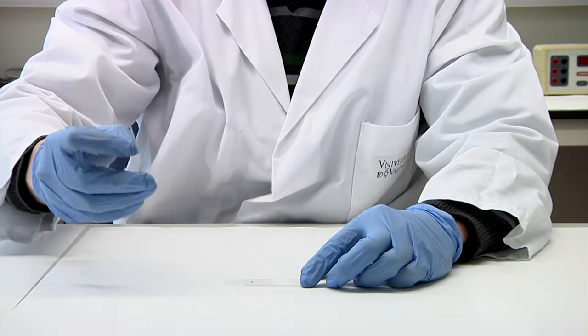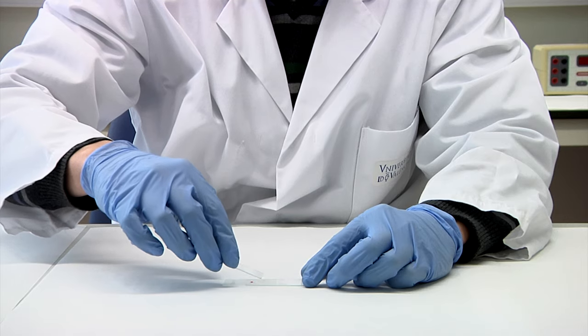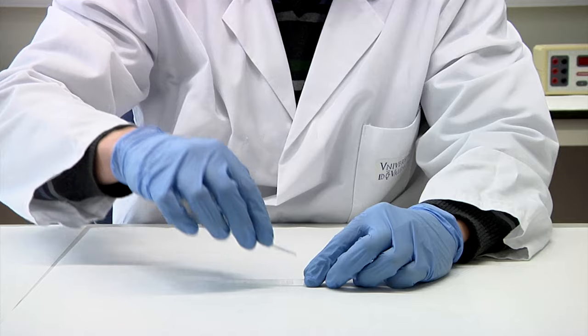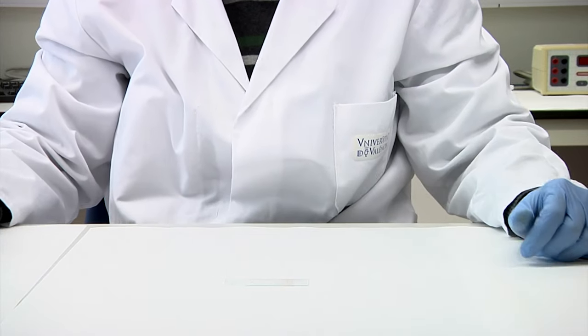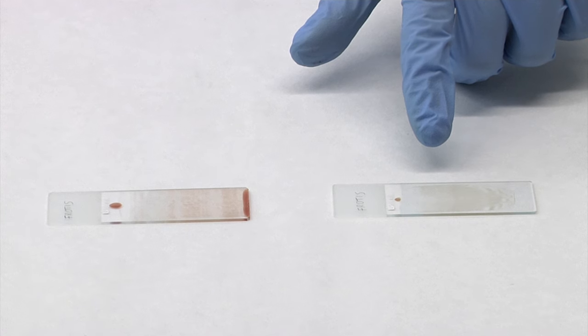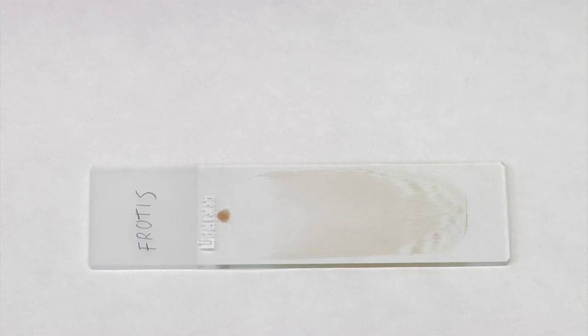Let's see the procedure at real speed. This will be an appropriate smear to continue the protocol. We can distinguish different parts in it.